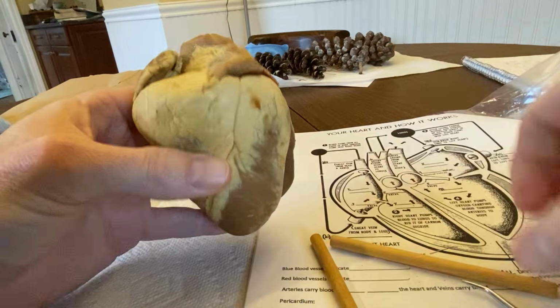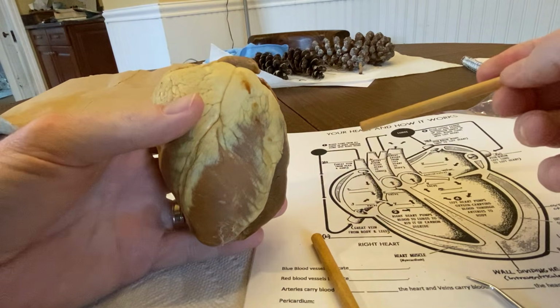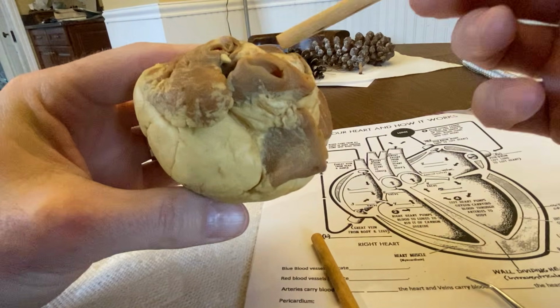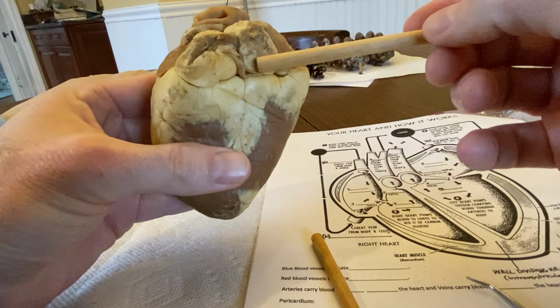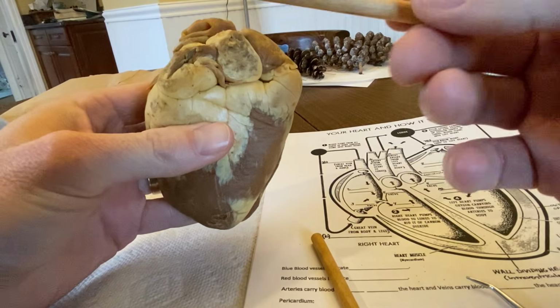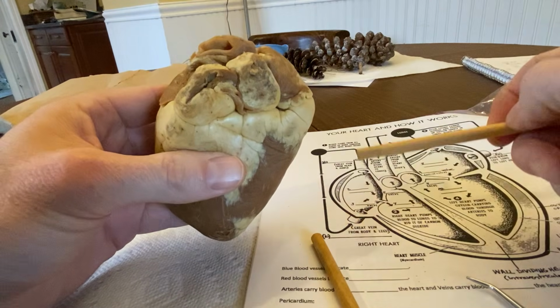So the two atria, and one of the things that's also interesting is if you look at the front of the heart here, the atria are almost invisible because, we call them left and right, but they're really both on the back. The back of the heart, if I flip this around for you, is actually going to be the busiest area. This is where all your veins are. The superior and inferior vena cava are in the back, the pulmonary veins are in the back, and the atria are really more on the back side of the heart as well.